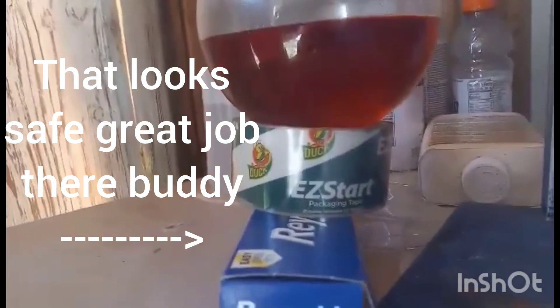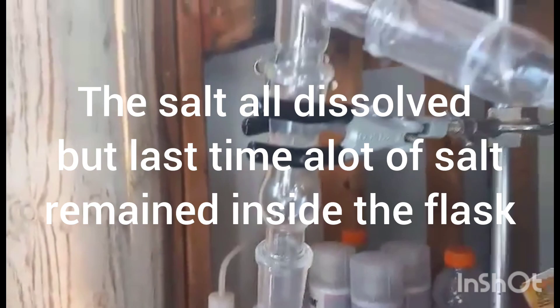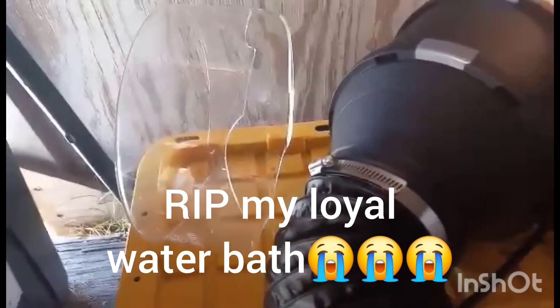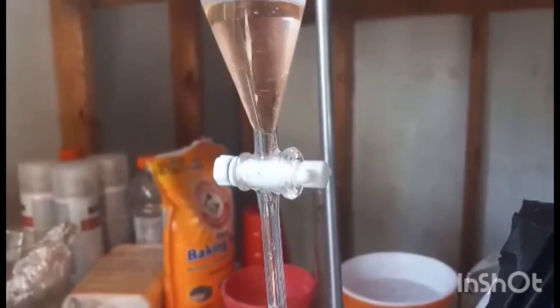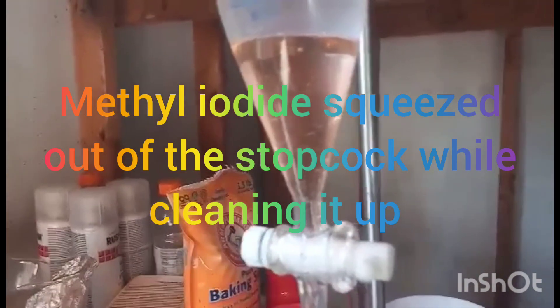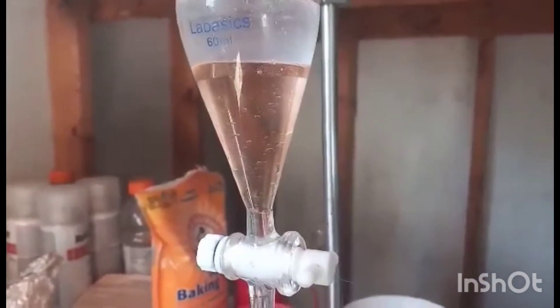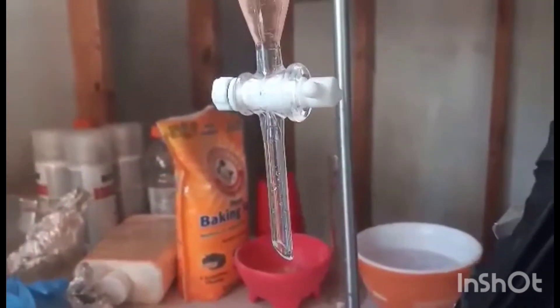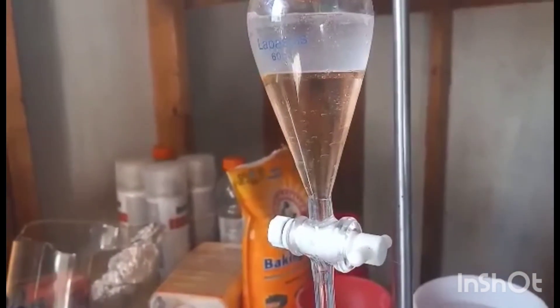Interestingly, all the salt has disappeared. I used the drying tube as an extension to get some fractionation. We got about 30 mils in our 60 mil flask, which is about what we should expect since it's not the most efficient. I'm going to add a small crystal of sodium thiosulfate to remove the color, then wash with water, some clean water, and a couple of salt water washings, then dry and store it.